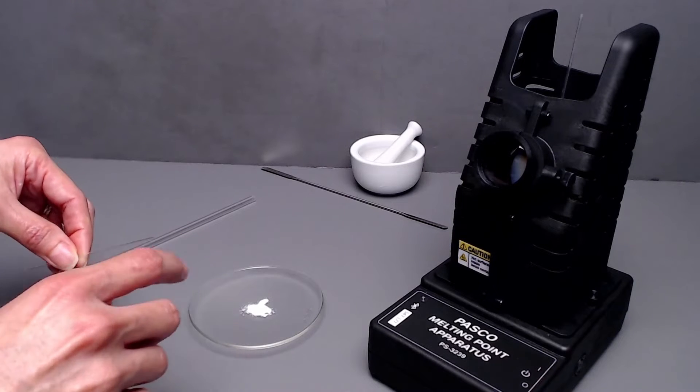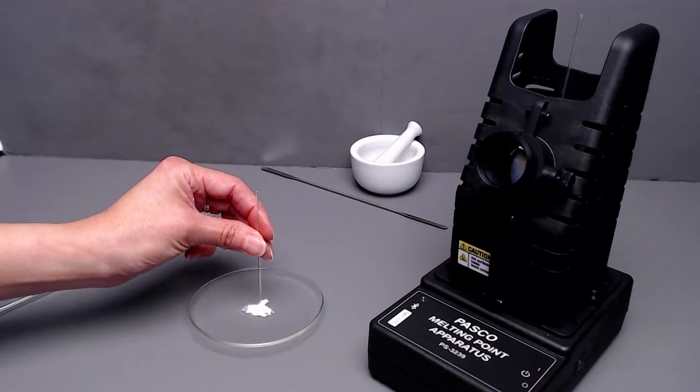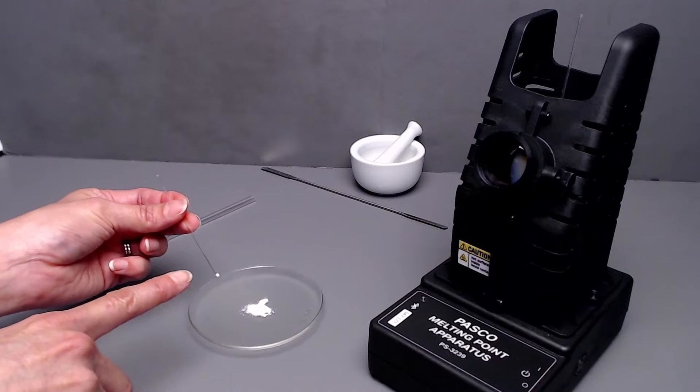Take the open end of the capillary tube and push it into the sample a few times to get a couple of millimeters of sample.